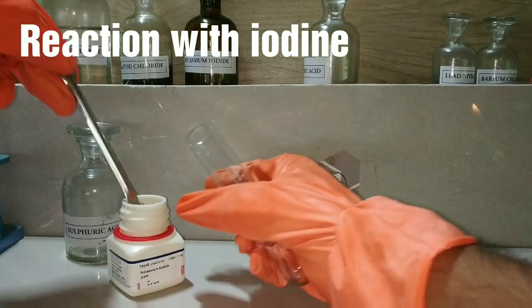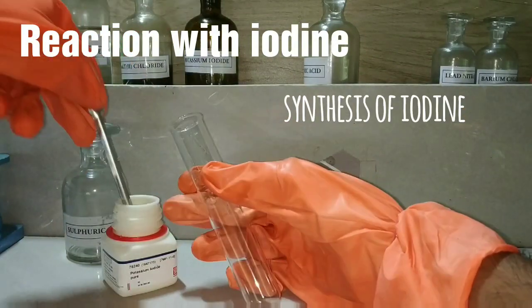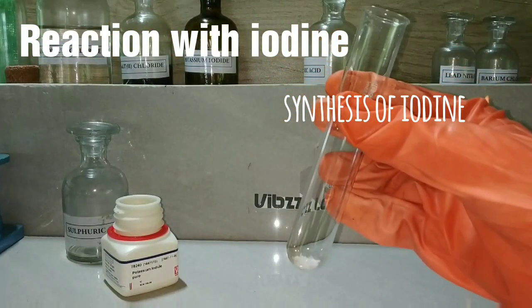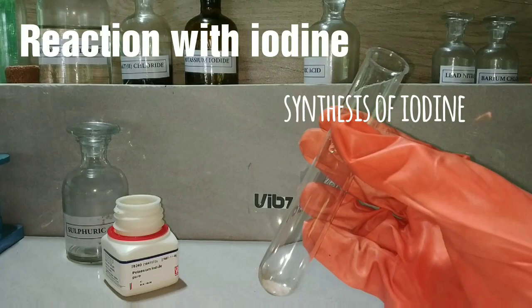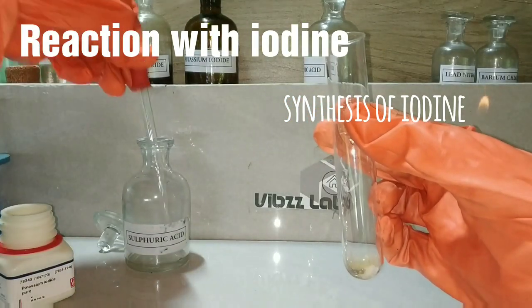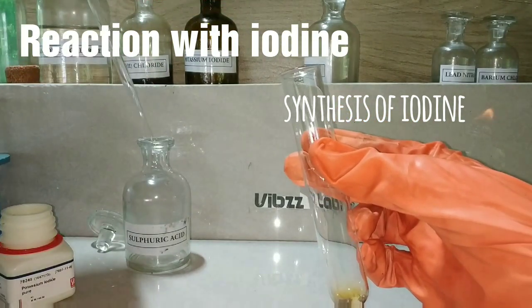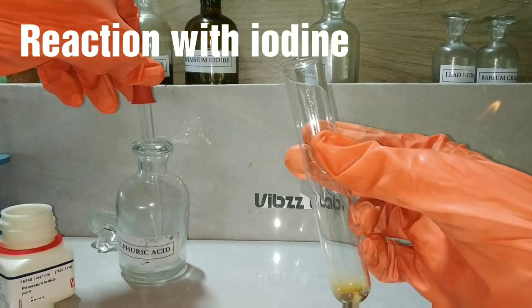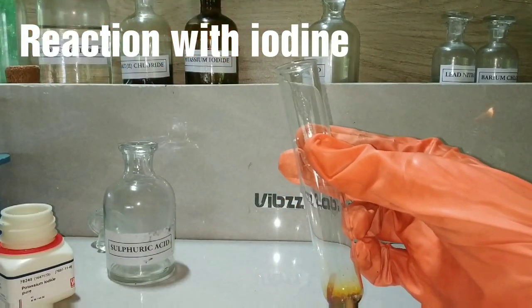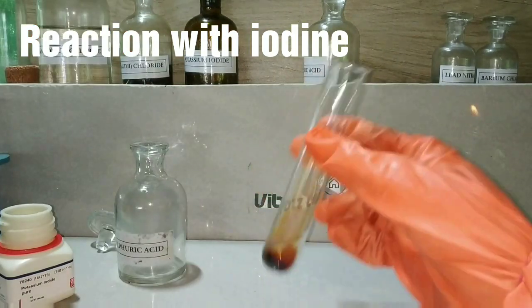Now we see the reaction of sodium metal with iodine. For that purpose, we have to synthesize elemental iodine. Here I have taken 2 spatulas of potassium iodide crystals in a test tube, and now I am adding concentrated sulfuric acid. You can see that on adding the acid, there is a dark coloration in the test tube. That is due to the formation of iodine. Other byproducts like hydrogen sulphide are also formed in this reaction.